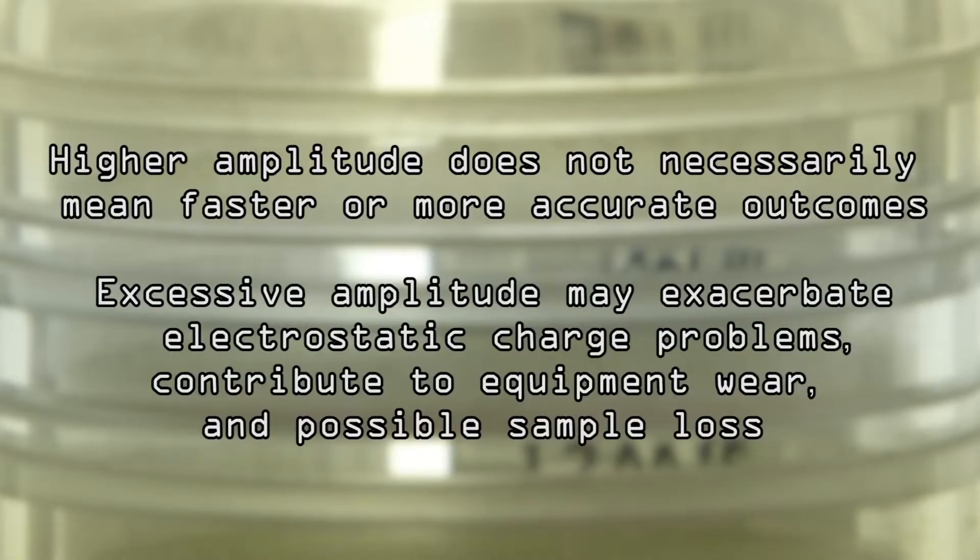Beware as settings for precision line sieves differ. Refer to the instructions on the jewel case of your precision sieve before proceeding with your test. It is important to note that higher amplitude does not necessarily mean faster or more accurate outcomes.